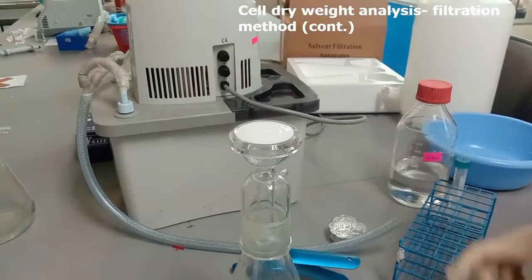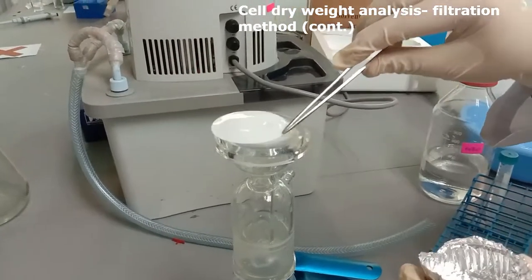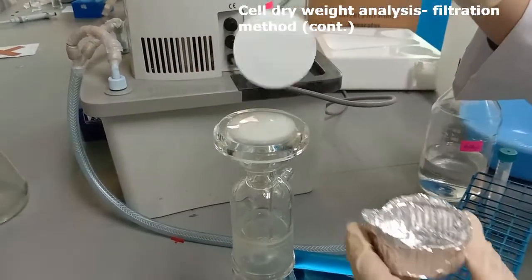When that is done, place the filter membrane back into the aluminum boat. Make sure to place it in the same boat it was taken from. Then place the cell pellet tubes in the oven.